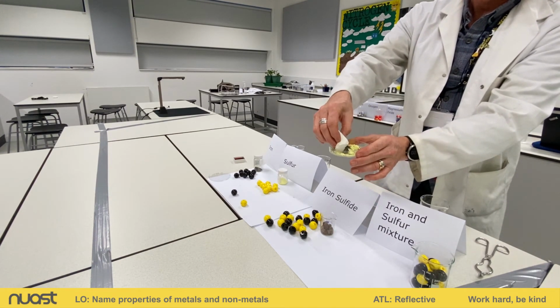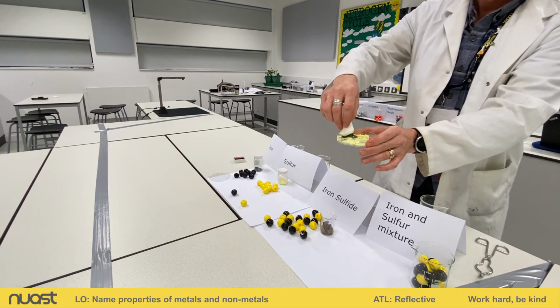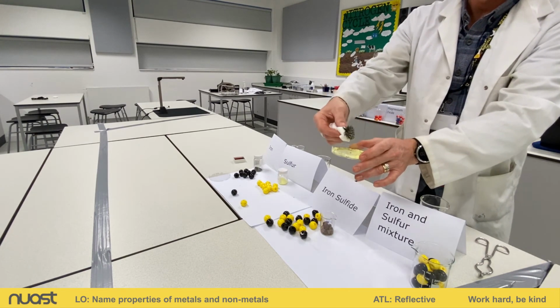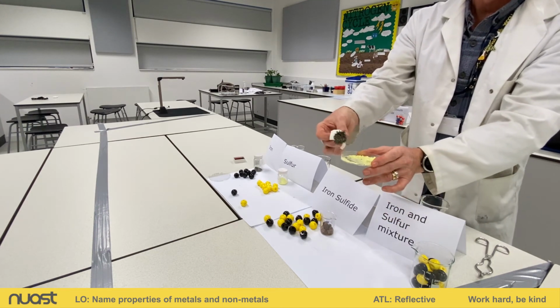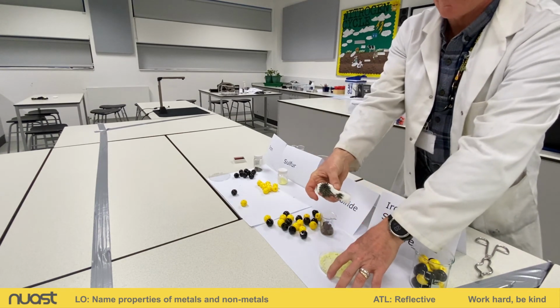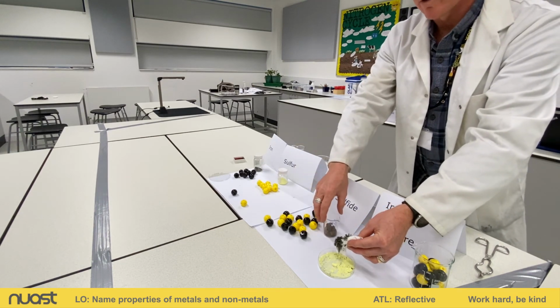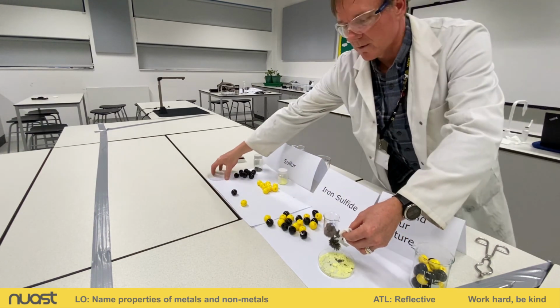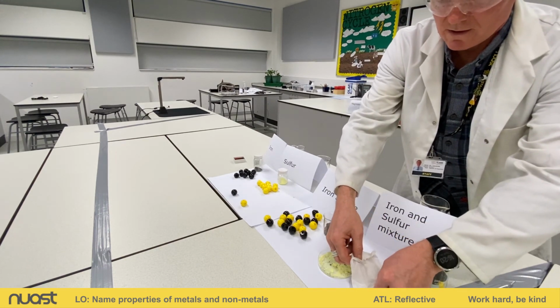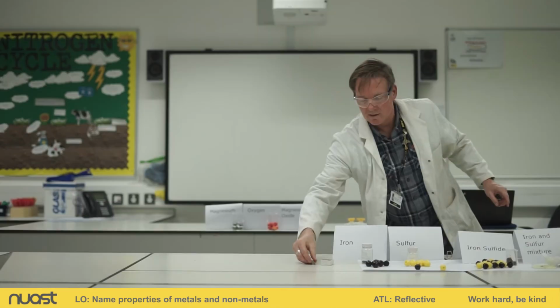You can see I can separate the iron out fairly easily by just stroking the magnet around the mixture. And you can see there's all the iron. I've got most of it out. Try and get the rest of it. There's a little bit of sulfur on there, but look how easy that was to do compared to trying to break up a compound. Okay, so see if I can get rid of the iron filings without losing them. Unwrap my tissue. There we go, and there's our magnet, nice and clean.